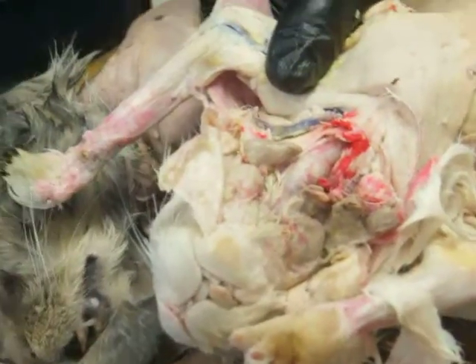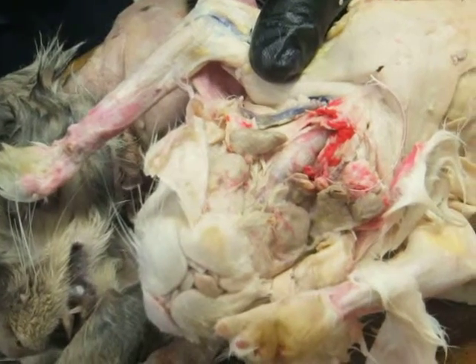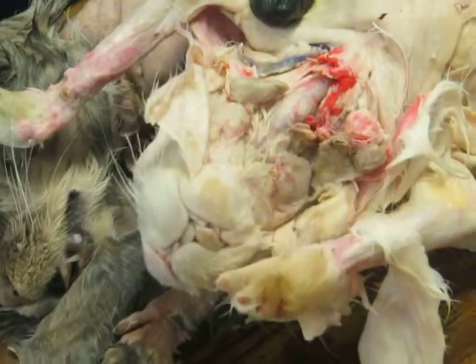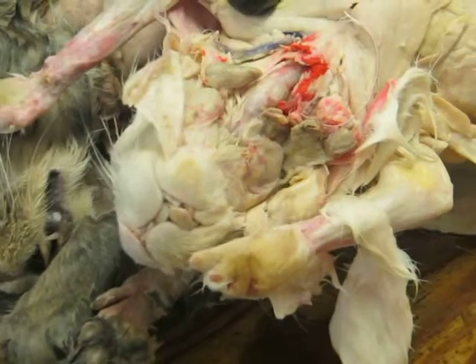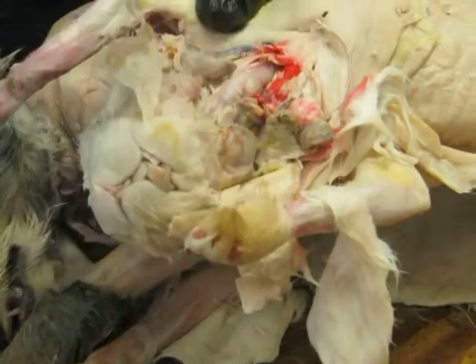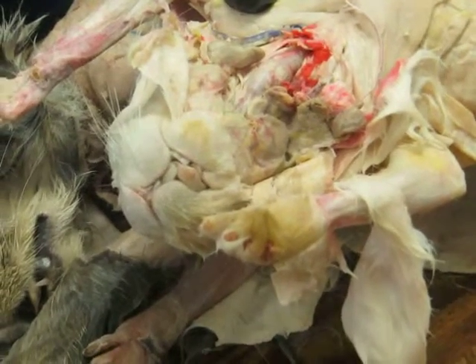And deep to that, running up into the tongue, is genioglossus, which we looked for in Necturus, and it was very unimpressive. It's actually quite a bit more impressive in these guys, but really hard to see because it's kind of up into the tongue. And we'll see it later when we actually get somebody to get brave and cut the head of their rabbit or cat in half and look at the two halves, and we'll get a good view of that.